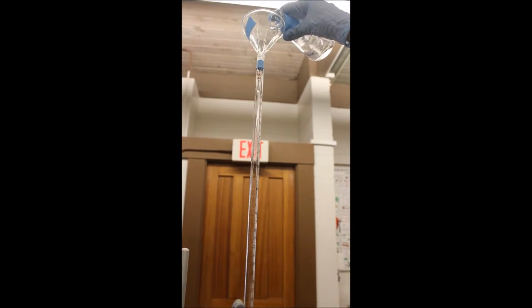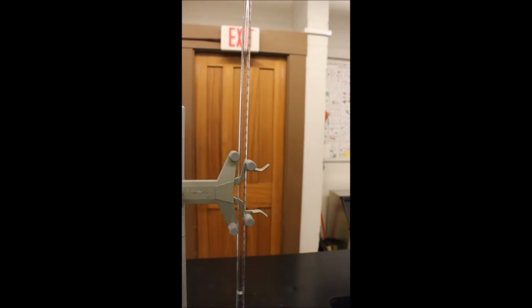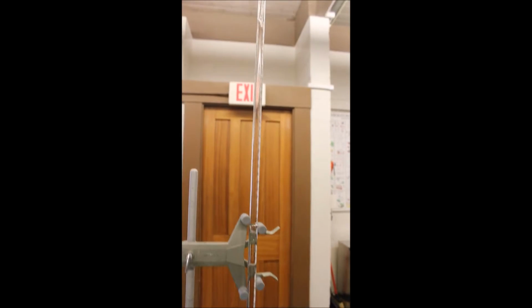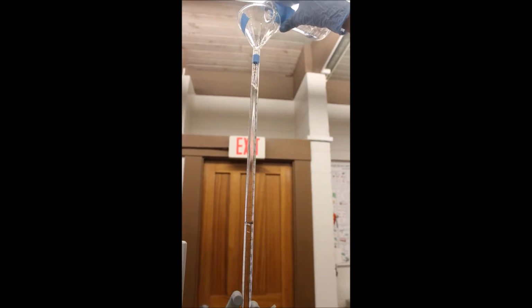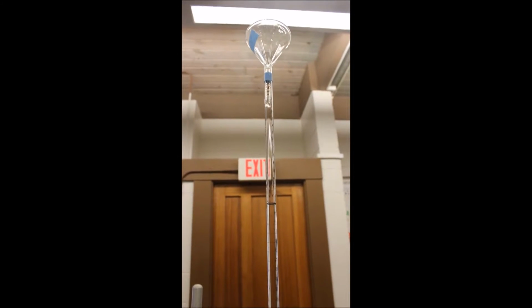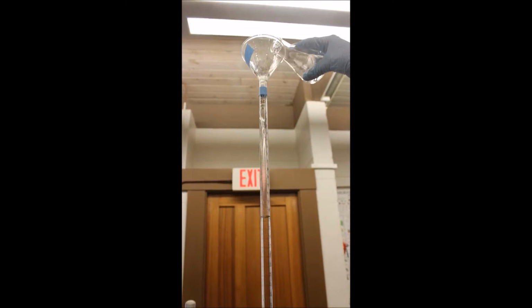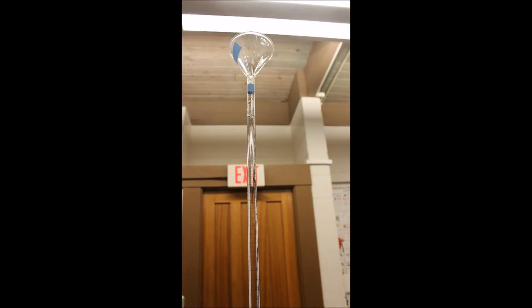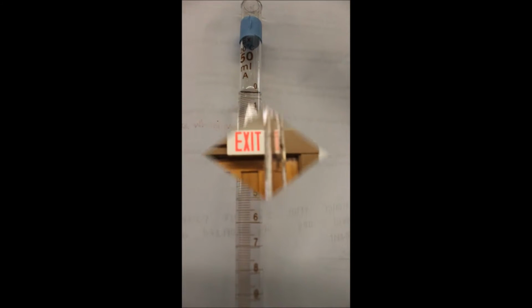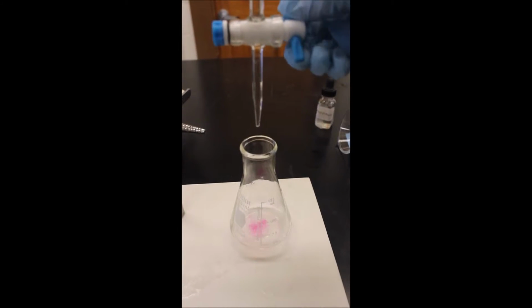The other burette was filled with the standard base solution to a point above the calibration line. The concentration of the standard base was known to a certain degree of precision because the base was previously titrated with an exact mass of solid acid, which is the primary standard. Some base was released from the burette to remove any air bubbles and lower the volume to the calibrated portion of the burette. The volume of base was recorded to the nearest 100th milliliter and was used as the initial volume. The volume was recorded at the bottom of the meniscus.